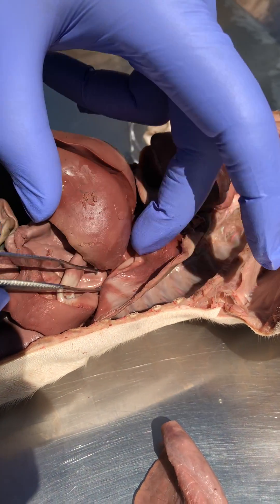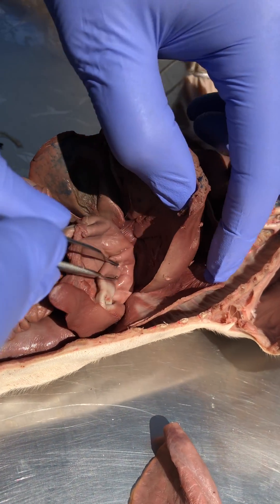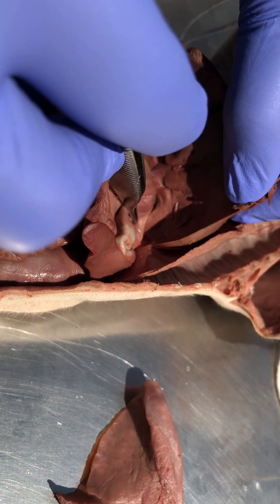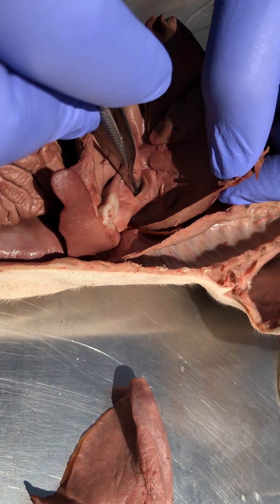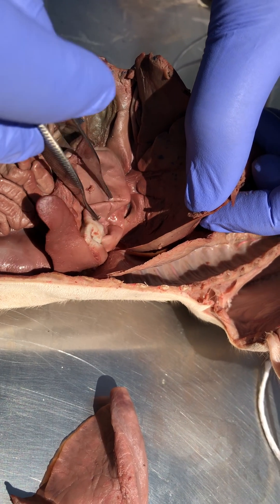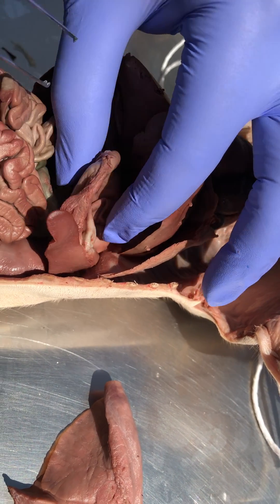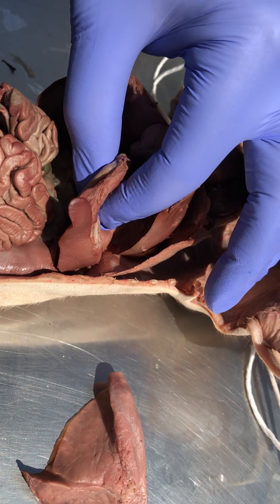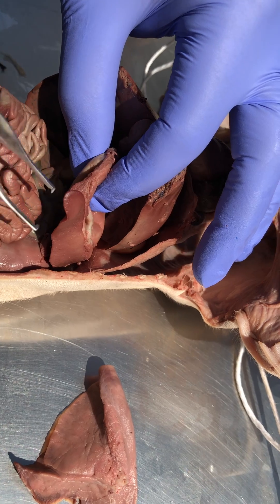It's going to come behind the liver — you've seen that already. As we lift the liver up, we can see where the esophagus is going to end and dump material into the stomach — this pouch right here. And of course, because this is a fetal pig, it's never eaten, so the stomach is developed but it's never been used yet.